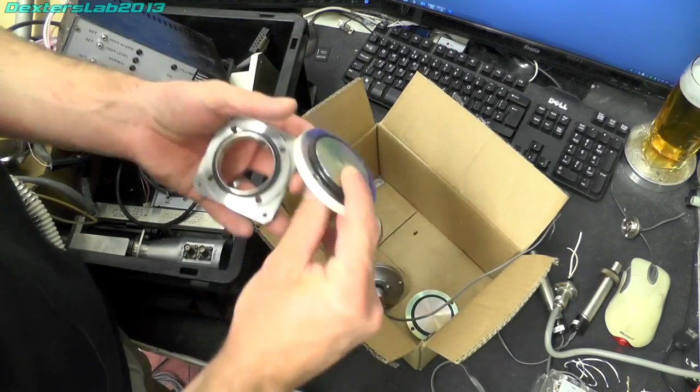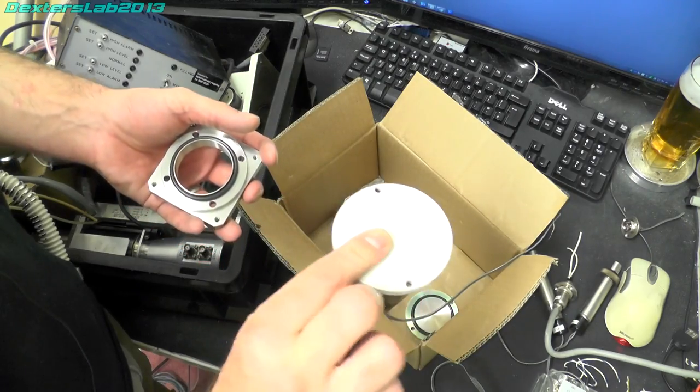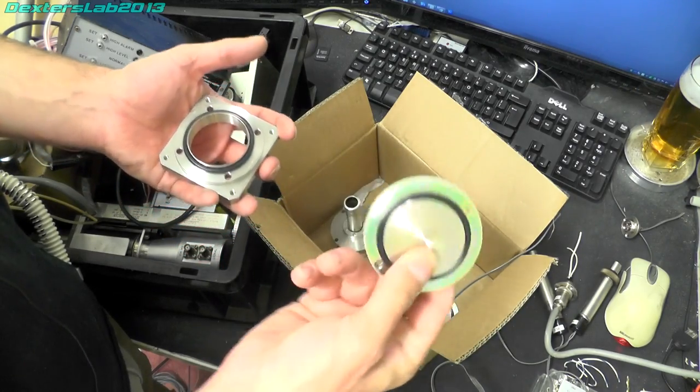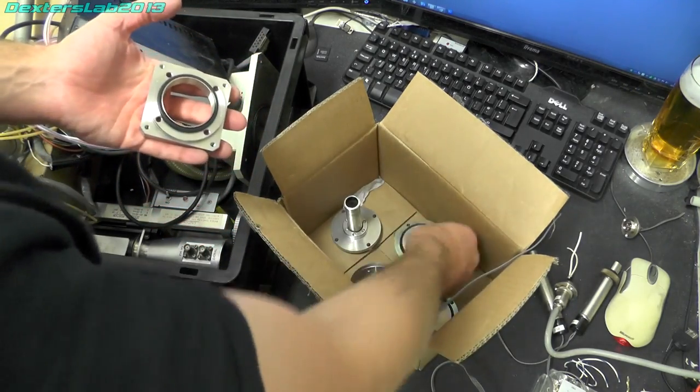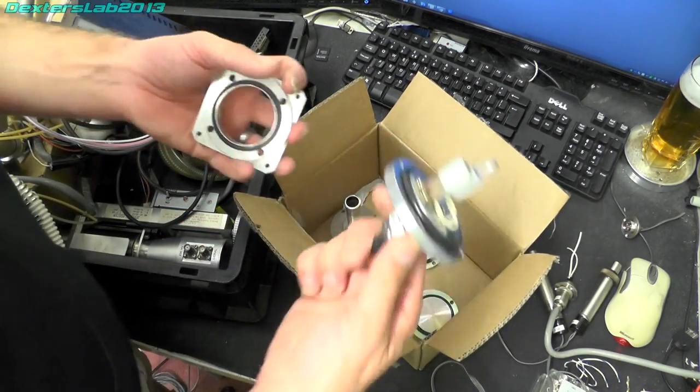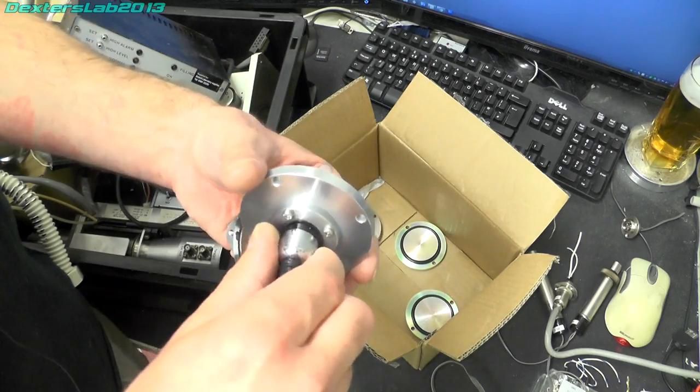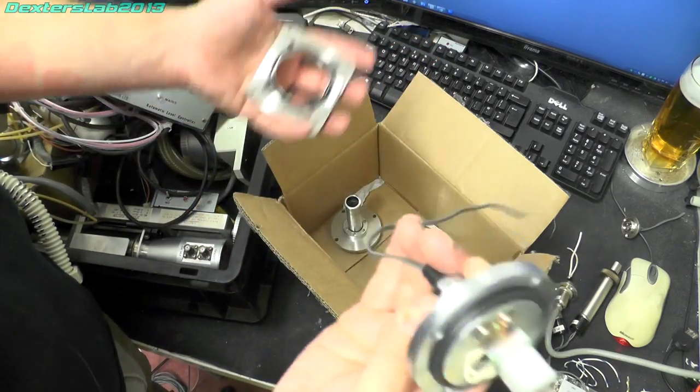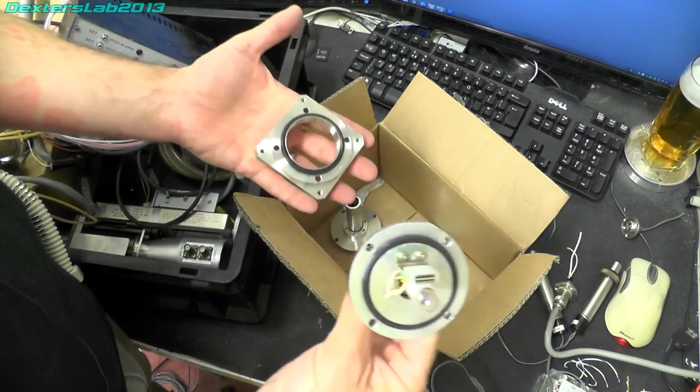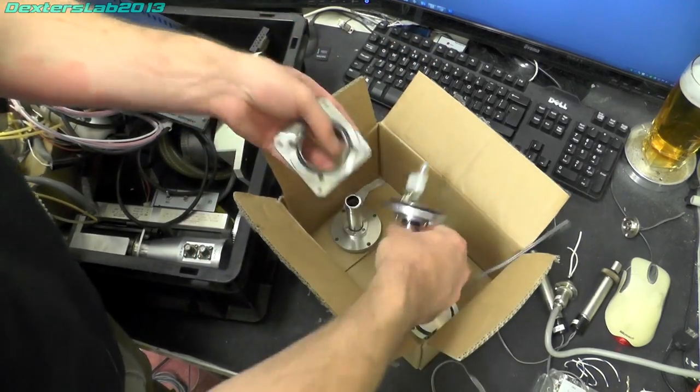So I've saved off the blanking plates from the sample chamber. We've got the little light there that's got electrical feed through so those have all been saved.